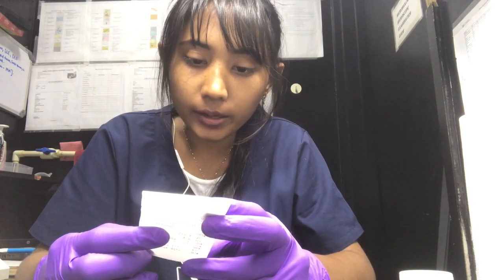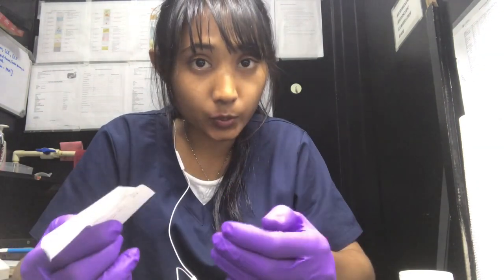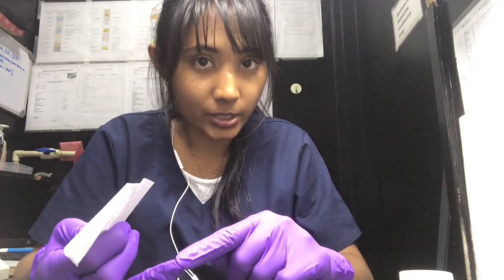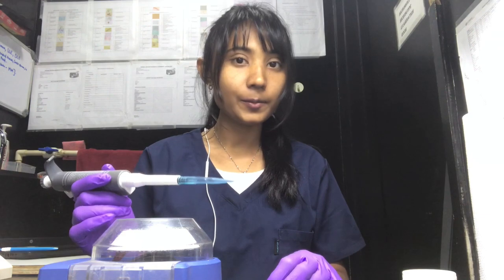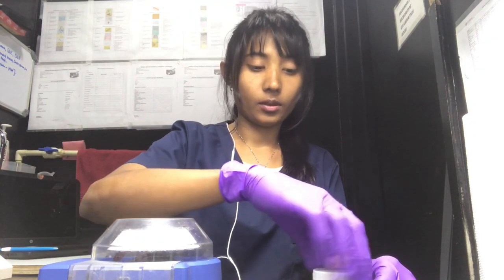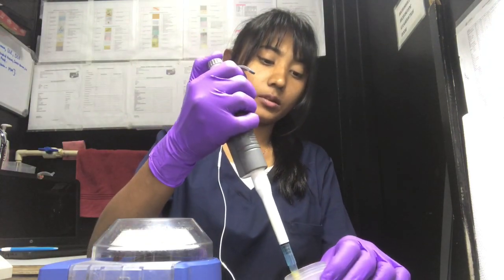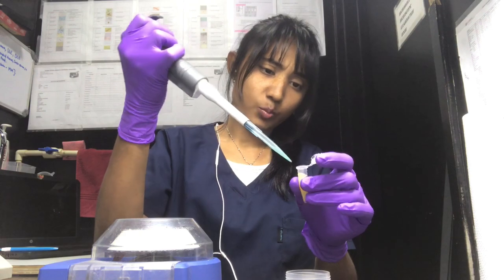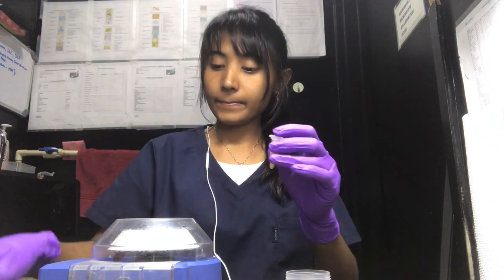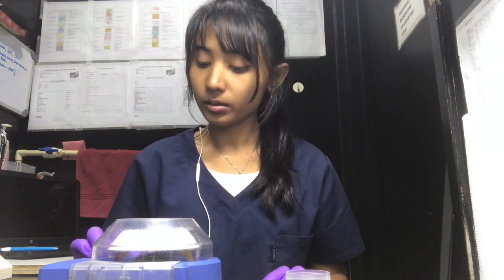I think this urine sample requires a cytological examination. I'm going to show you how I do both sediment analysis and cytology. I have a micro centrifuge and I'm going to centrifuge the urine for almost one minute. I'm taking almost 1 mL of the urine sample and putting it in the centrifuge tube, then centrifuging it for one minute.